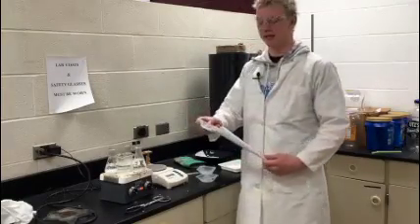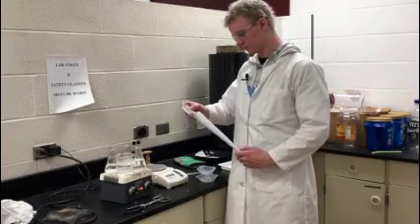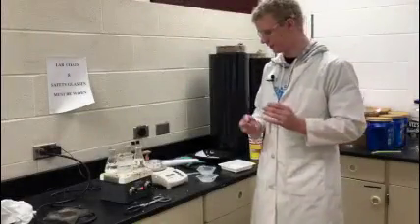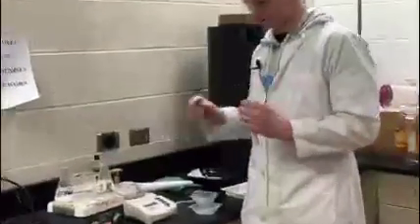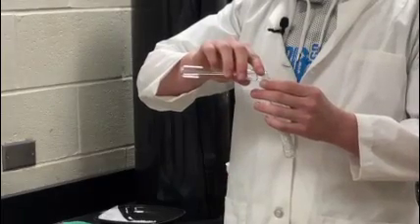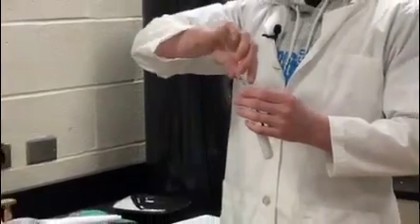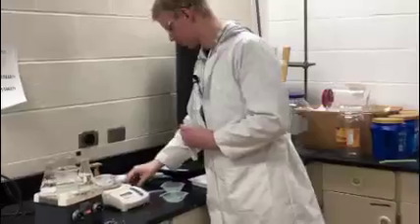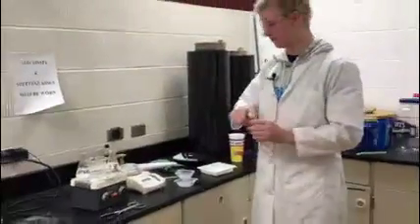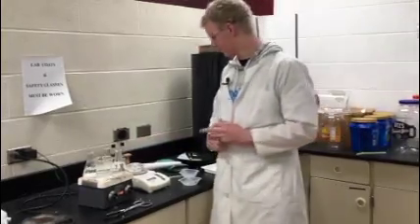Make sure none of the pellets get out because then you can't use that sample anymore. After you have all your pellets in there, you're going to take some room temperature water and pour it into your test tube, then close the cap. You wait 24 hours — so you have until tomorrow — until it is done.